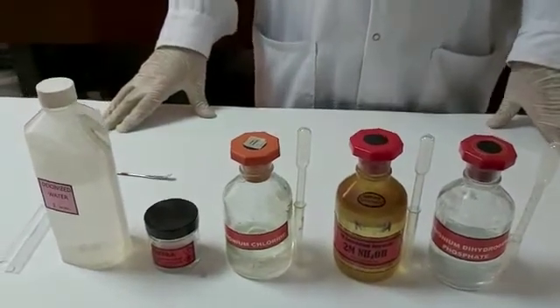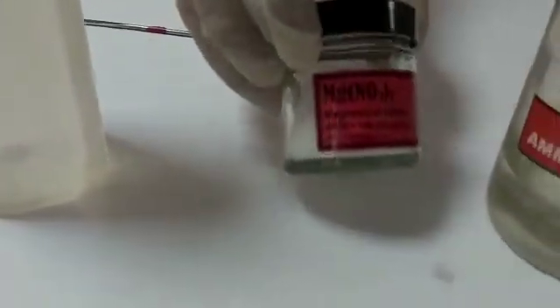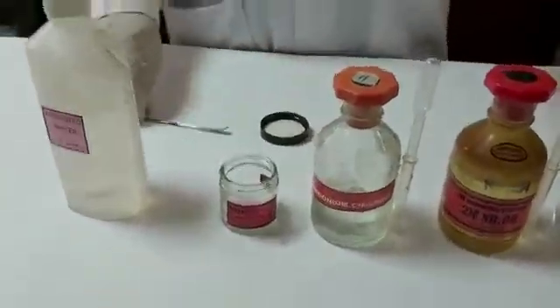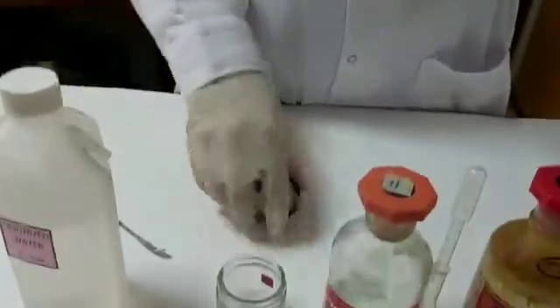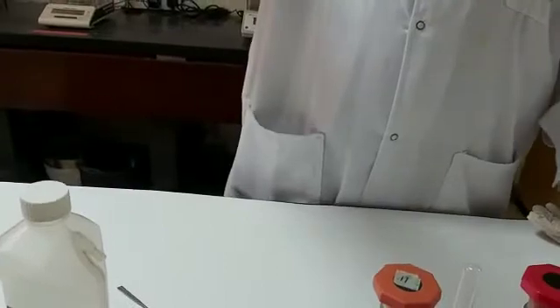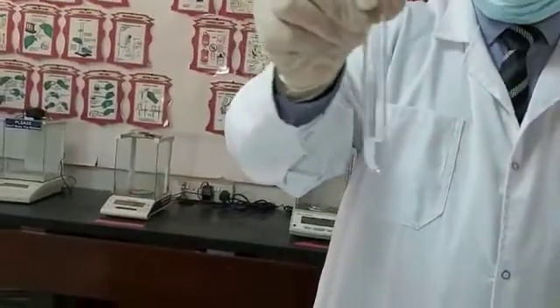We will be starting with magnesium. We are using magnesium nitrate, and we know from the beginning that Mg is present. We collect the test tube, then with a spatula add a small pinch of the salt into the test tube. Then I will be adding some distilled water to make what we call the salt solution. We shake a little bit, the salt dissolves, and the solution is ready.